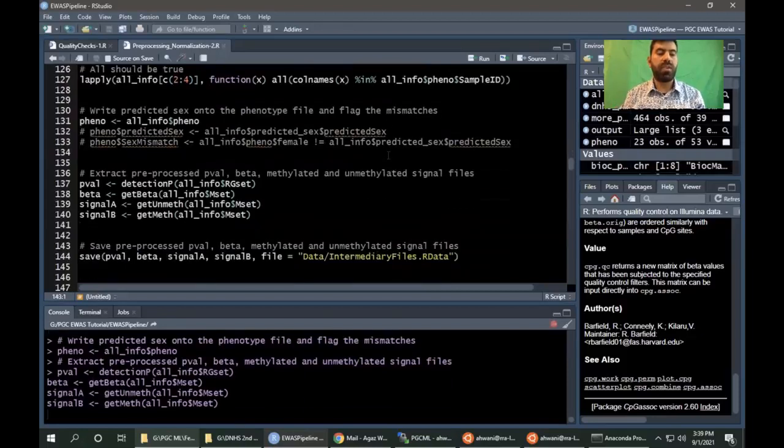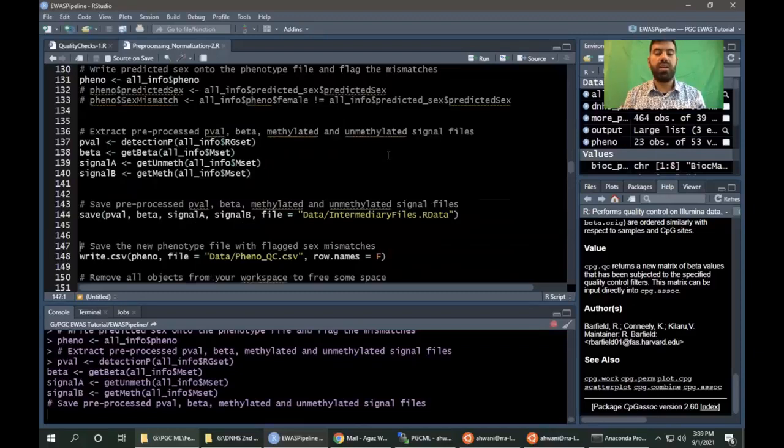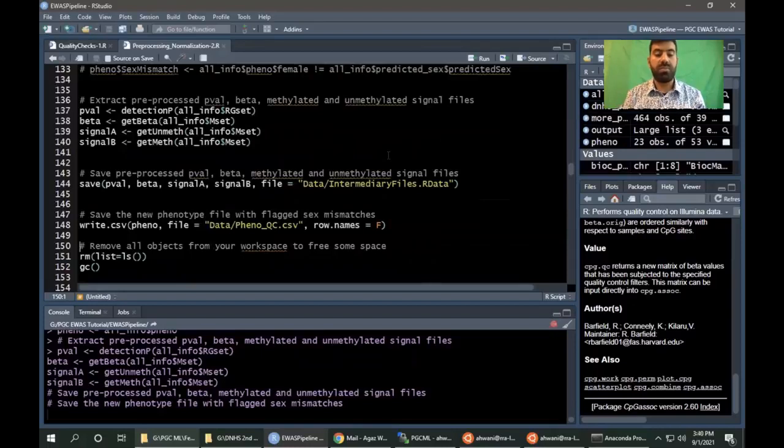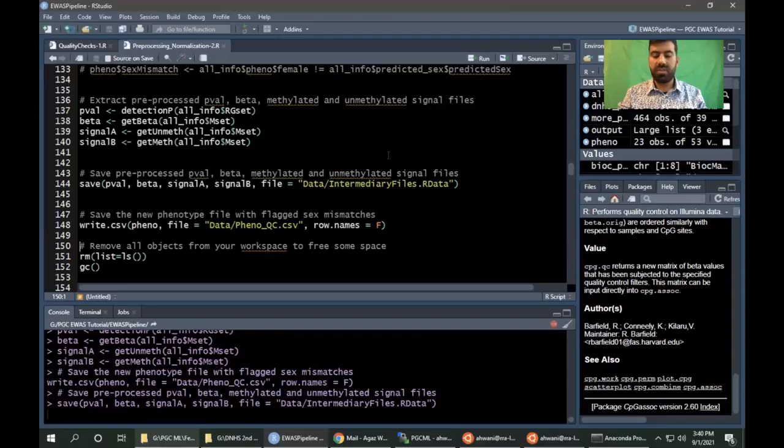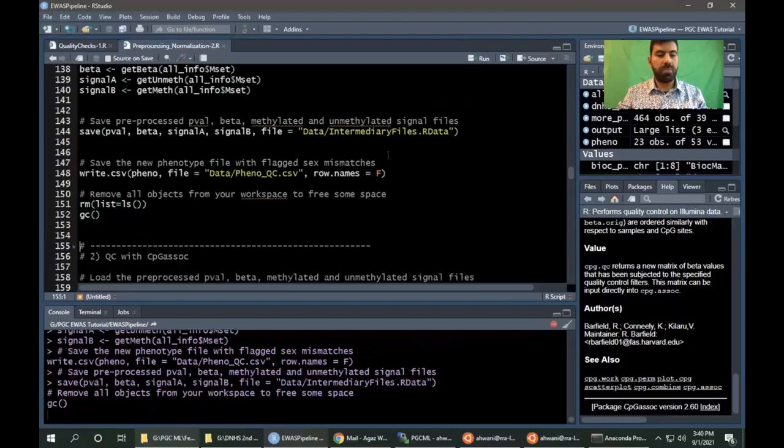So we also need to have p-value, beta value, signal A, that is unmethylated information, and signal B, that is methylated information, to perform some other steps. So we will also save this information so that we can use it in the future steps. We will also save this updated phenotype information to use it in the next steps. So once we have saved this data, then we will clean the environment and load the data again to perform some other quality control steps. So we are almost done with this step.